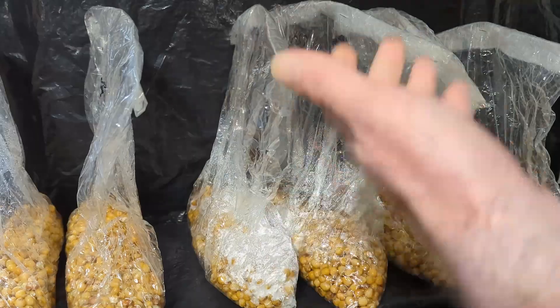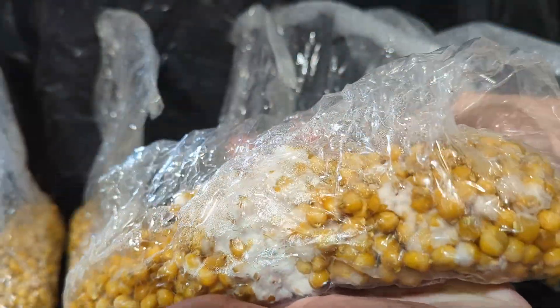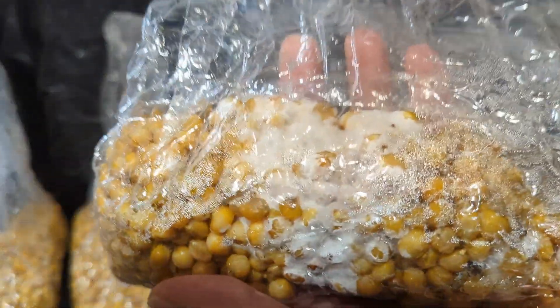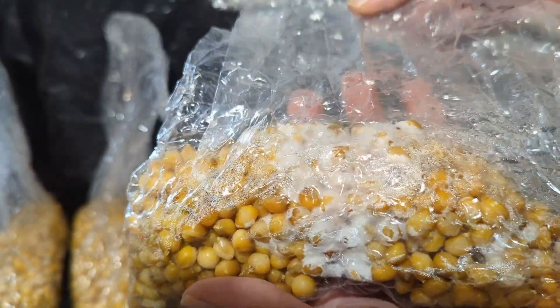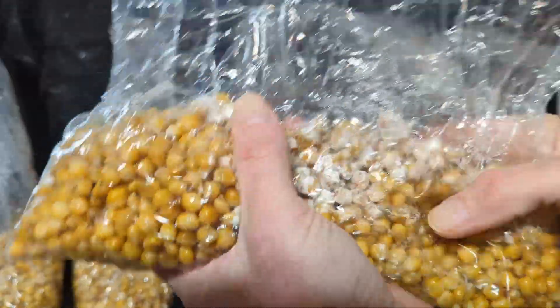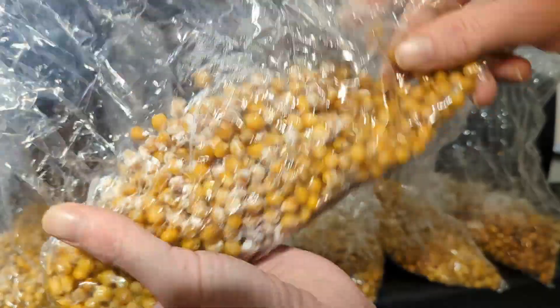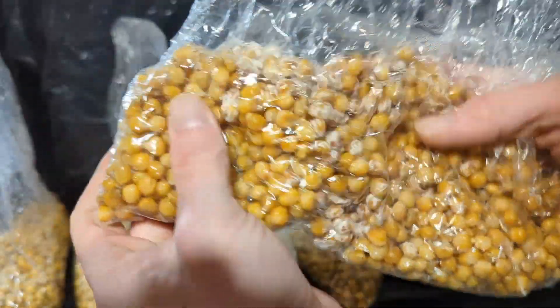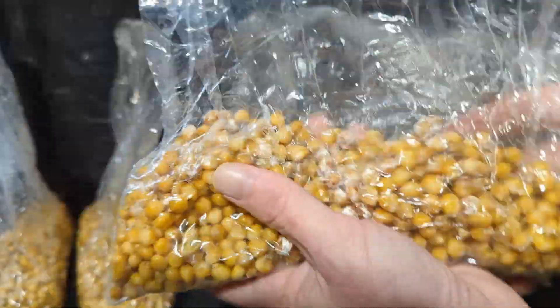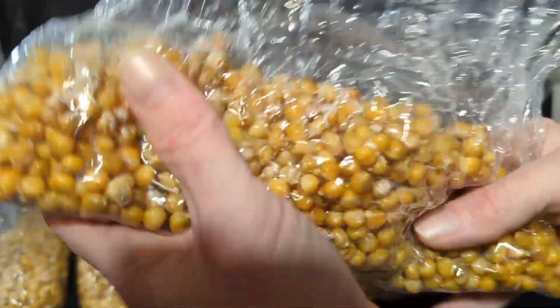Another reason we do break and shakes at 100% is to check for contamination. When you break and shake healthy mycelium, it should completely recover in two to three days. If it doesn't, that could be a sign of contamination in the spawn. It's possible for bacteria or fungus to get in there. Bacteria can be hard to detect just by looking. One thing to look out for is grains that won't fully colonize — there might be part of each grain the mycelium won't grow on no matter how many times you break and shake. This is a sign of likely bacterial contamination. Things to look out for are slime or goo. It will usually make the grain smell sour or rotten, but not always. Sometimes it can have a very neutral smell — it should smell like mycelium and grain and nothing else.